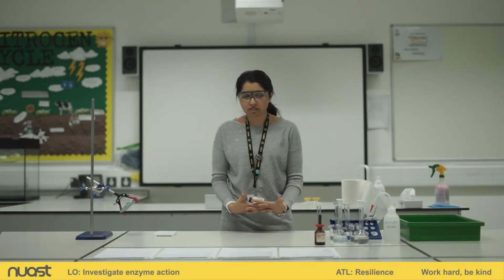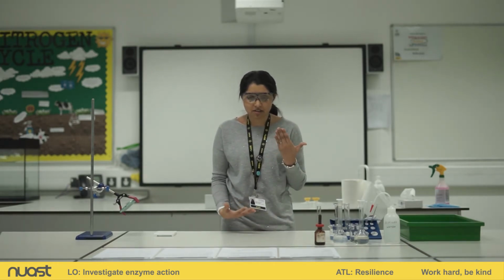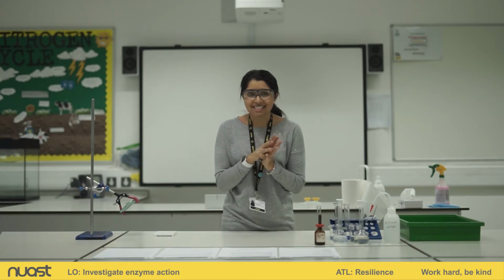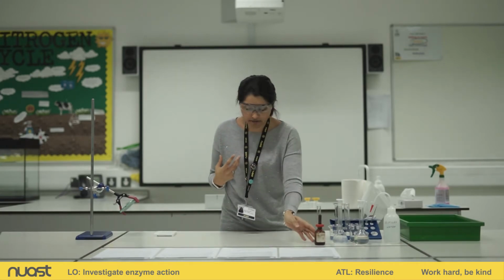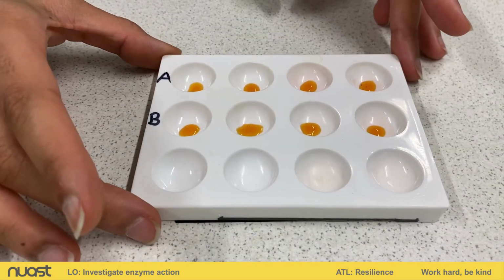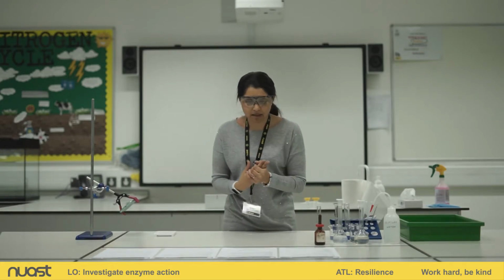Okay, let's have a look at what we'll be doing in this method. What are we hoping to achieve? So the first thing I'm going to do is think back to what I already know. And I already know, and you should already know, that starch, when it's added to iodine, what colour does it turn? Have a think about that. Yeah, that's right, blue-black, well done. So it turns from this orangey colour that you can see here in these wells to a blue-black colour.